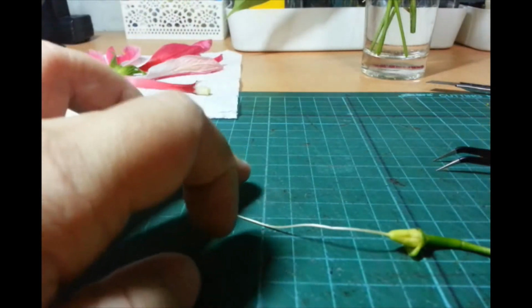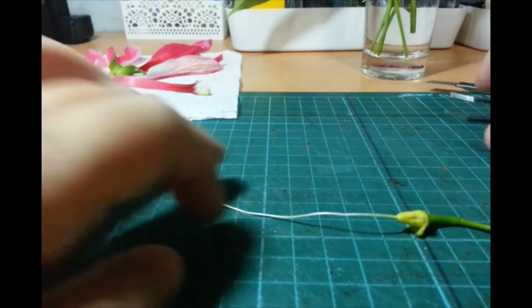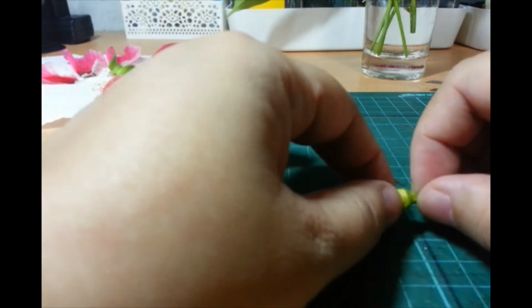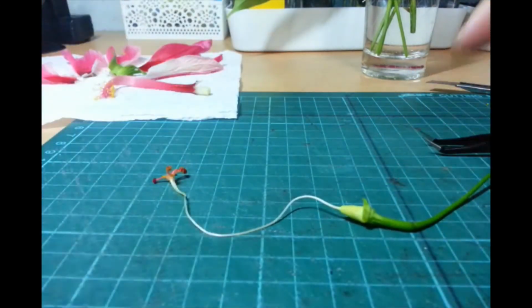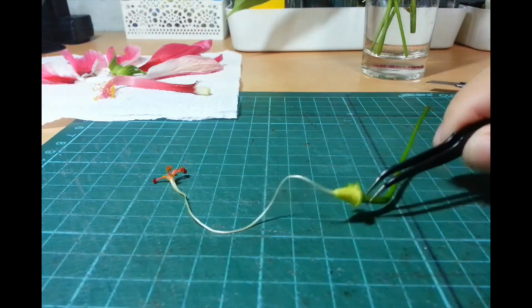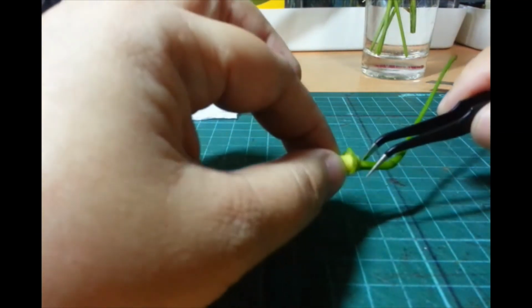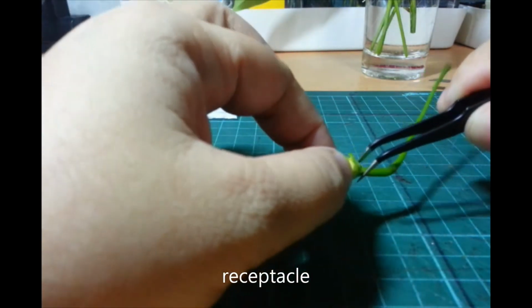Sorry, medyo bugbog na yung aking cutting mat. Okay? It's been used a lot. Okay. So, before I remove this pala, you have the stalk na, which we call the pedicel. This part here, where the ovary rests, you also have a fleshy part here. It's called the receptacle. Okay?